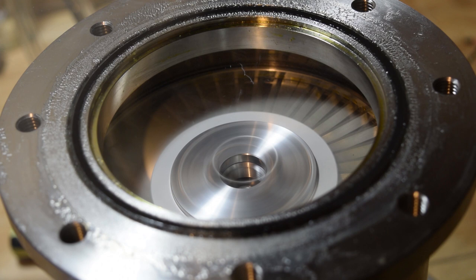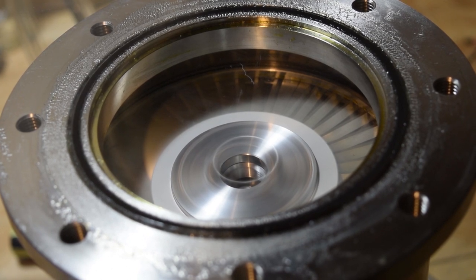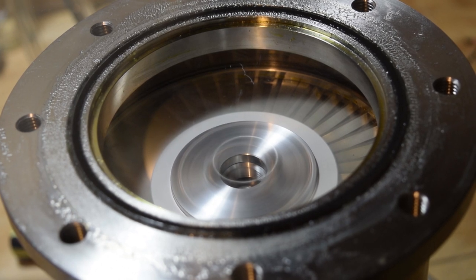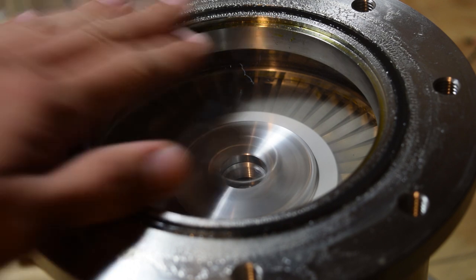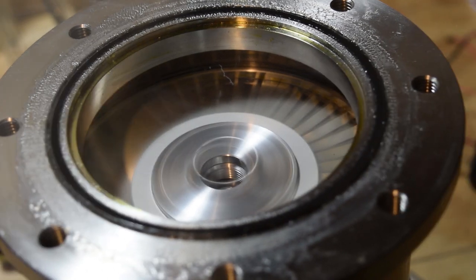I don't run the pump for very long yet, mainly because I don't think I have quite enough turbo pump oil in it. Once it's filled with oil I will feel safer running it for longer periods of time. It's very dangerous to run a pump at its top speeds with not enough oil — the high precision bearings will become worn out and basically explode inside the pump. The ball bearings become projectiles, spinning off the walls and breaking all the turbines inside.